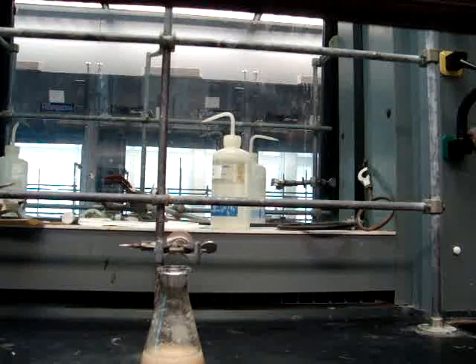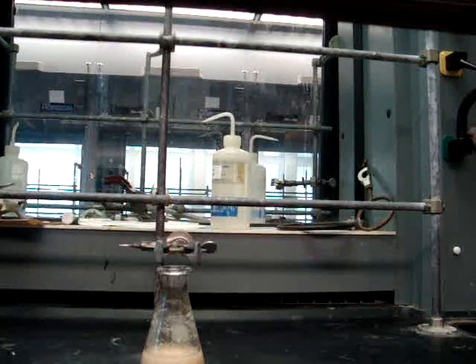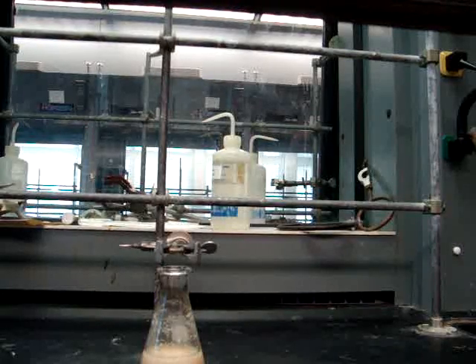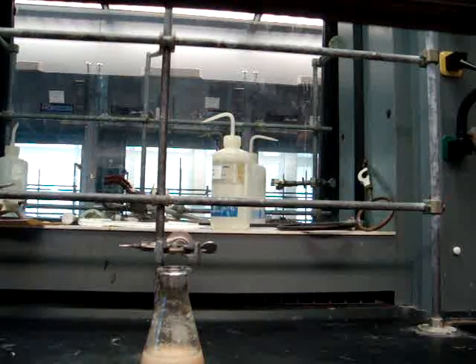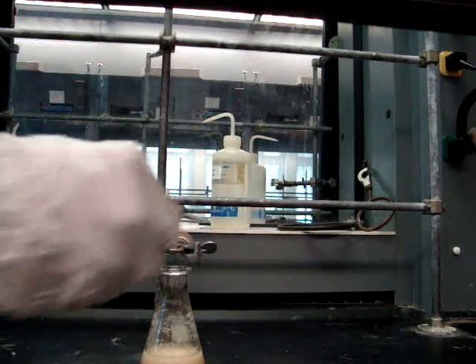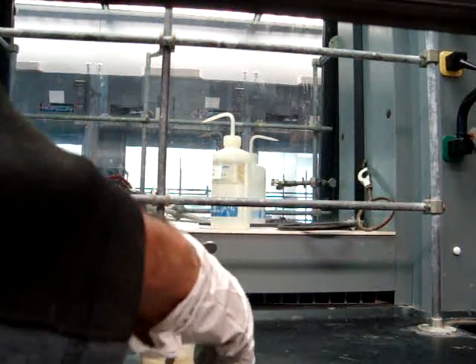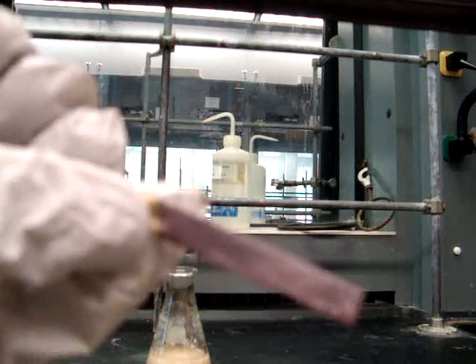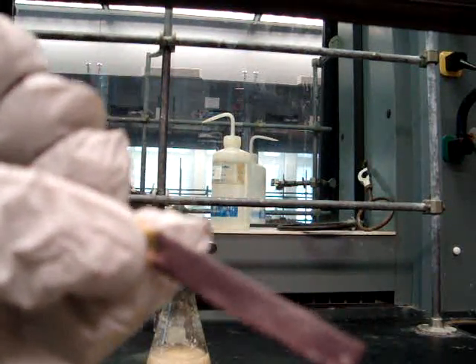Now we'll be doing a KI starch test. White KI starch paper will turn blue-violet for a positive test, which is what we are looking for. This represents a positive KI starch test.